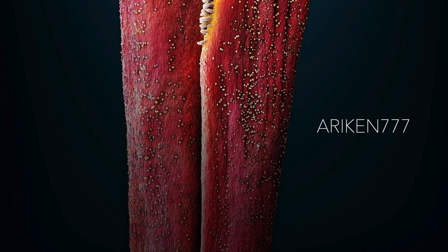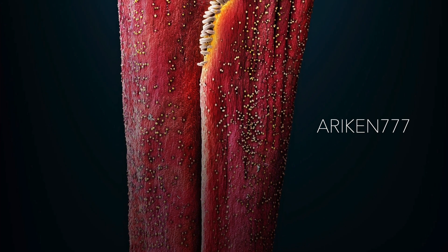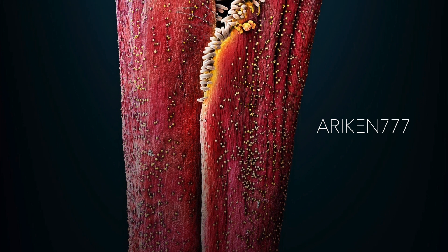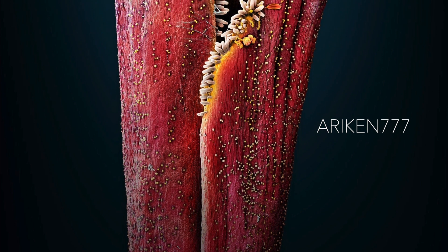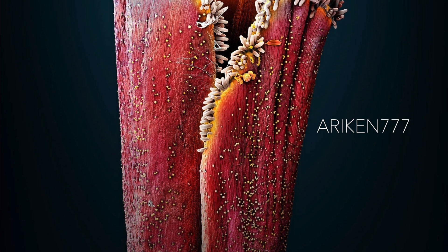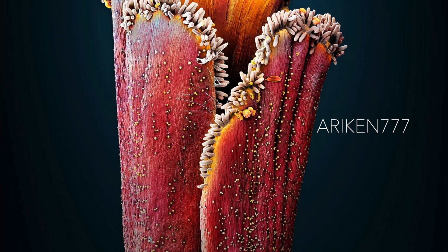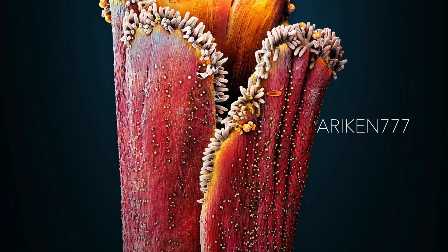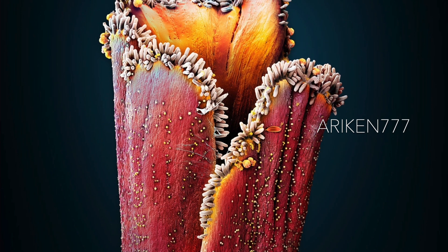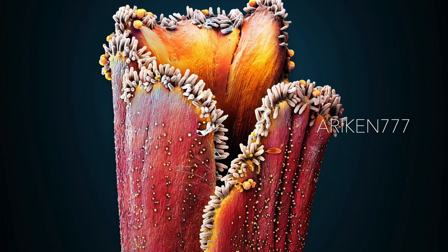A stigma of a saffron flower, also known as Crocus sativus. Some 150 compounds in the stigma give saffron its pungent taste and hay-like fragrance. Saffron stigmas from each flower are hand-picked during autumn and quickly dried for use in cooking, flavoring, or as a colorant. It takes about 210,000 of these stigmas from a football field's worth of crocuses to yield one pound of saffron — this is why saffron is the world's most expensive spice by weight.